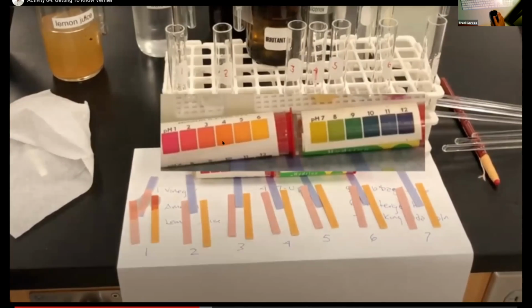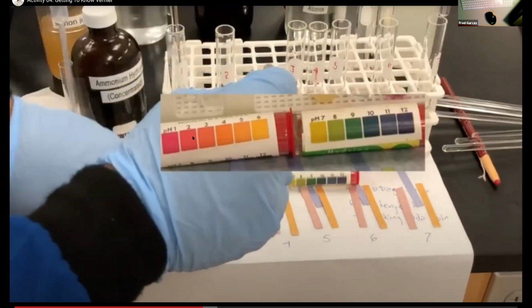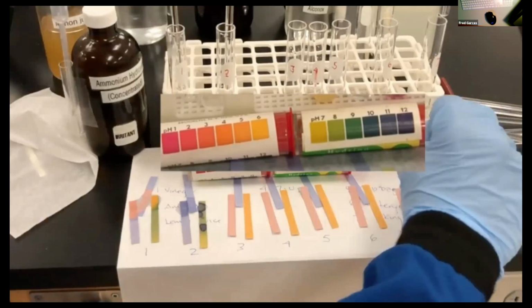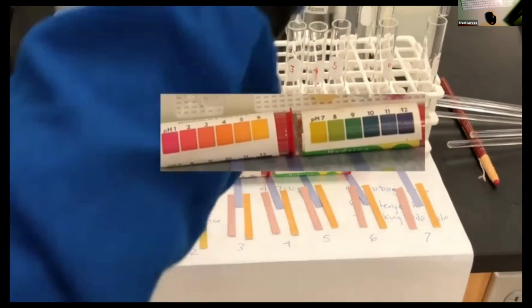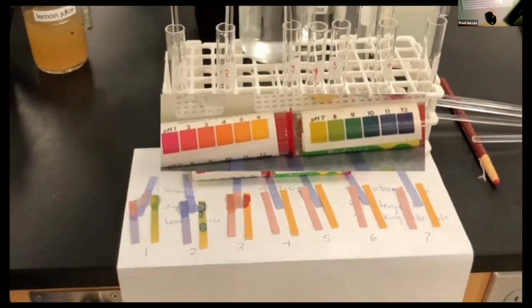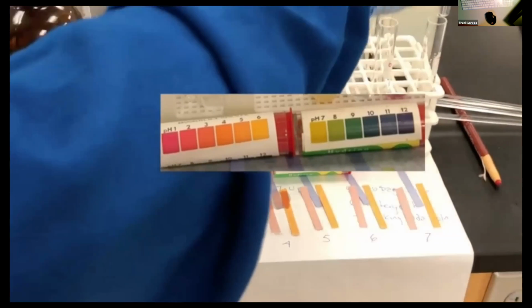And I put an inset of the hydrion paper. The reason I did that is because notice that I am touching a glass stirring rod to each of the solutions and then wetting the test paper. When you wet it down, you need to make sure that you can do a reference. Colors may vary depending on your monitor, but they should all vary evenly. That's why I have that illustration of the different colors shown here.